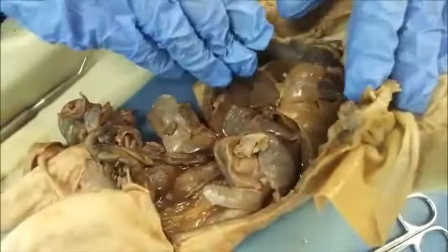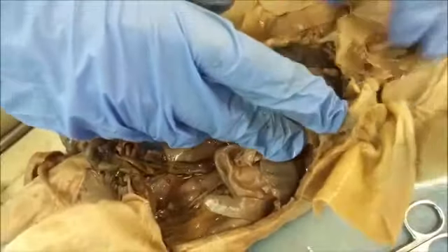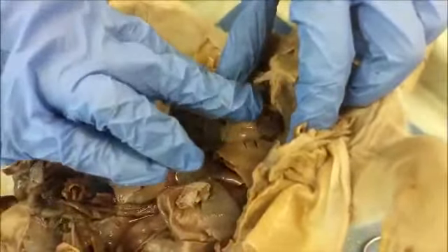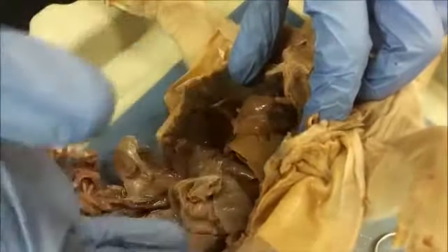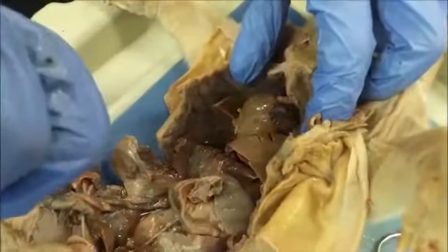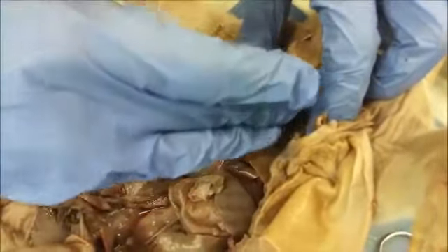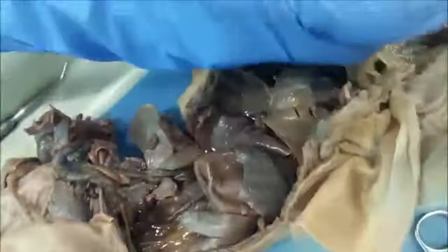With the heart back in the cavity, oxygen is taken in through the lungs via the trachea, coming down to the lungs, and arteries will be branching off the heart that lead into the lungs. Blood will go into the lungs, dump out its carbon dioxide and other wastes, and take in oxygen and bring it back to the heart to be pumped out through the aorta. The aorta will come down the body and diffuse out to the rest of the body. Coming off the aorta are two brachial arteries that will feed into the limbs and into the head.